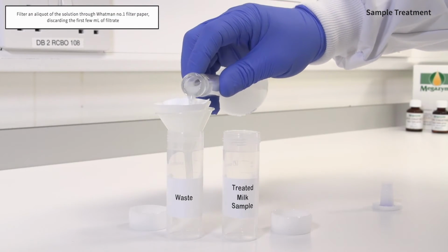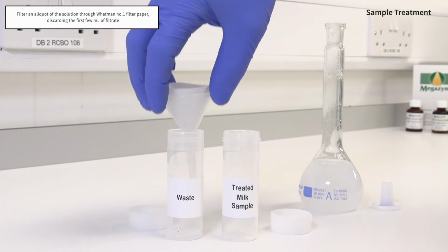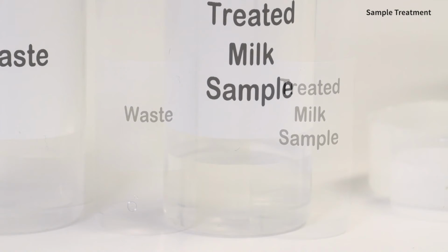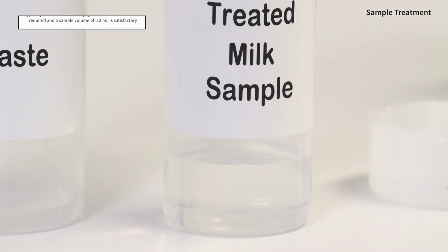Filter an aliquot of the solution through Whatman No. 1 filter paper. Discard the first few millilitres of filtrate. Use the clear filtrate sample solution in the assay procedure. Typically for milk, cream and yogurt, no further dilution is required and a sample volume of 0.2 millilitres is satisfactory.